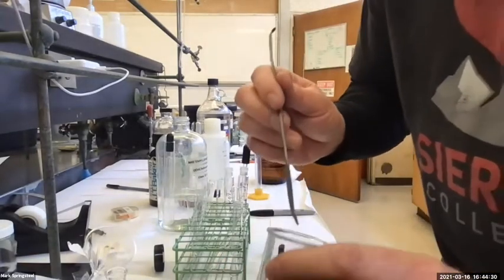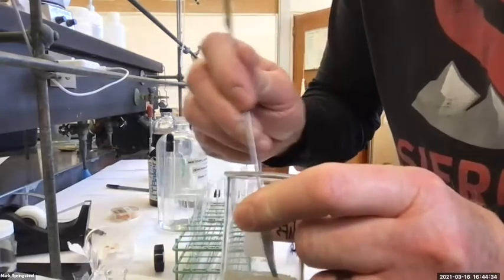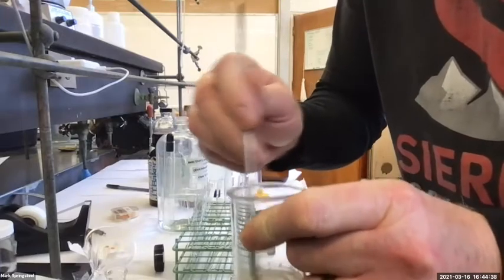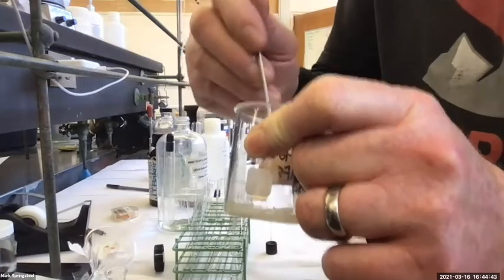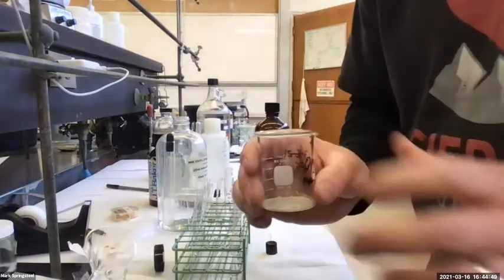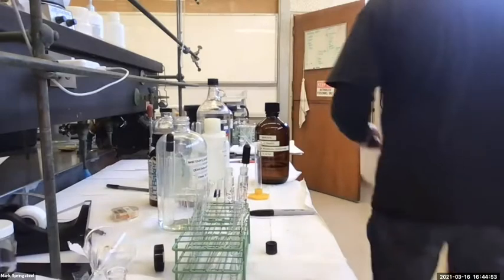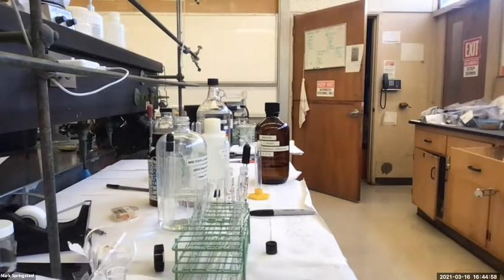So I've got this solid in here, and it's kind of coating the bottom funny. So I'm going to scrape it around a little bit. I think that's going to help it vent a little more of the organic solvent. Okay. Now I'm going to go weigh it. Let's get the weight of it and record it, so see how much we recovered. So I'll just come over and do it without bringing the computer at this point. So put that on the scale.